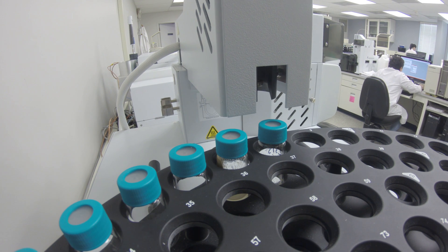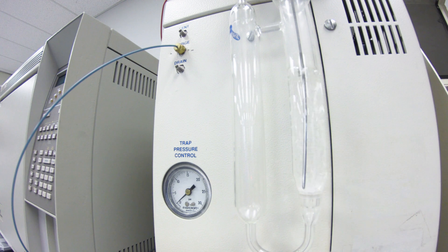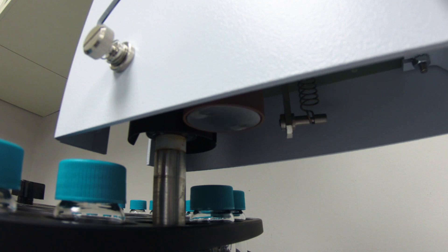Phase Separation Science is committed to providing its clients with the resources to ensure the highest sampling quality. In this video, you will learn how to take a TerraCore sample for VOC analysis.